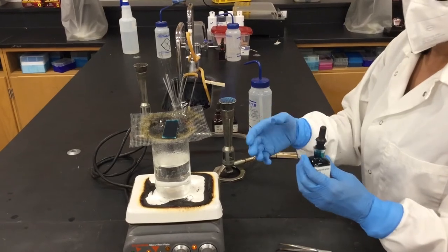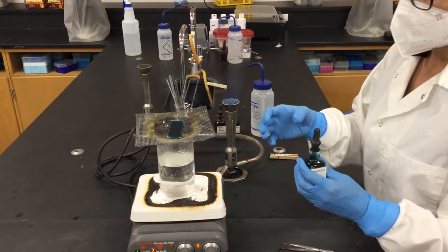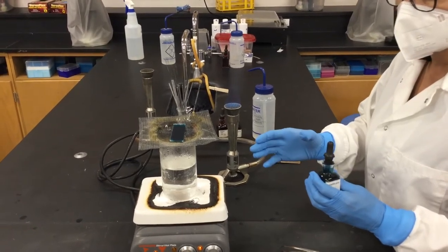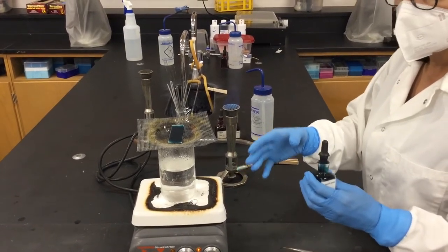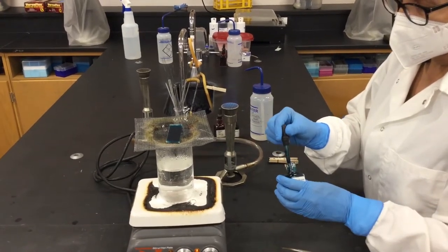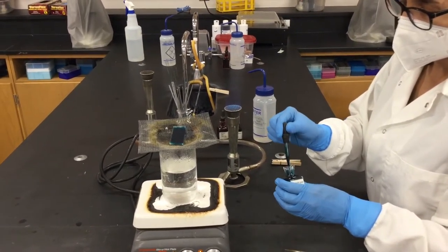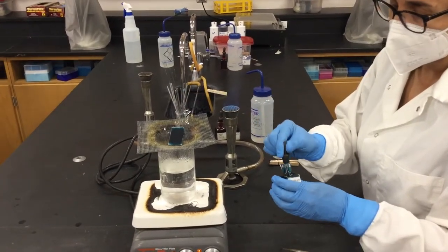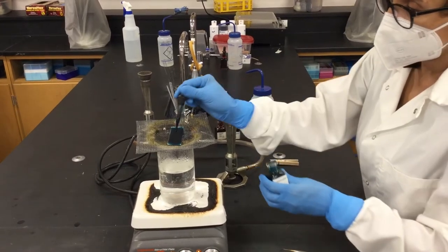And then you will keep it there until the bacteria definitely runs out of nutrients, and then it releases it into the environment. So this Bacillus cereus bacteria that we used today to make this smear, it has been starved like for a week or so.